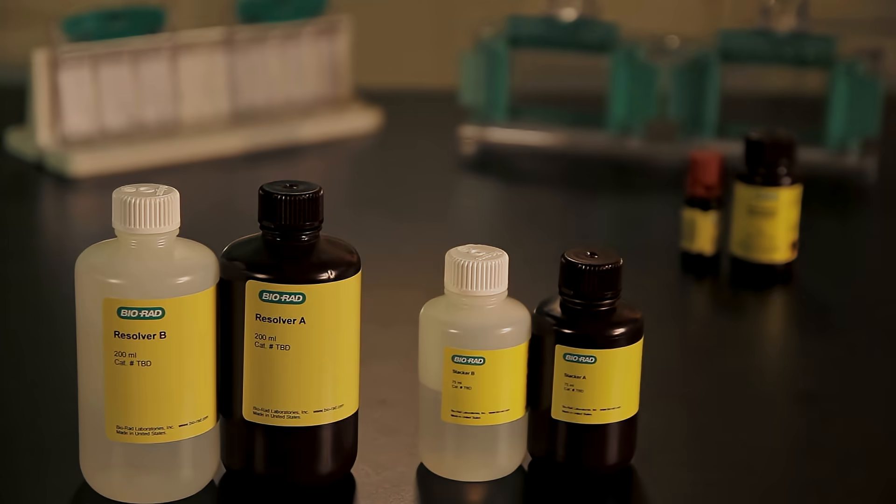This short video will walk through the steps to cast the TGX and TGX Stain-Free Fast-Cast Acrylamide Gels. Fast-Cast Gels can be run in as little as 20 minutes, provide superior transfer efficiency, and last up to one month.